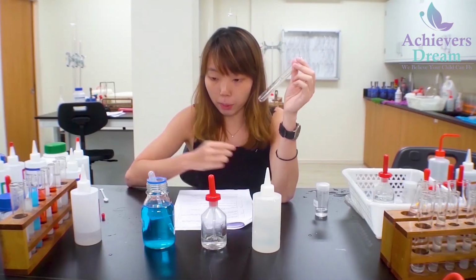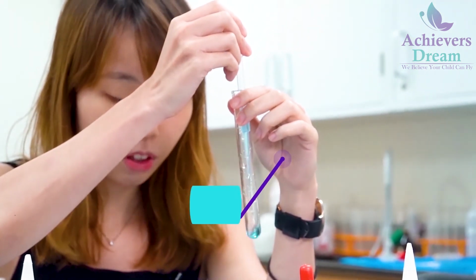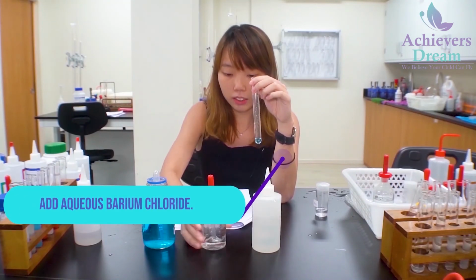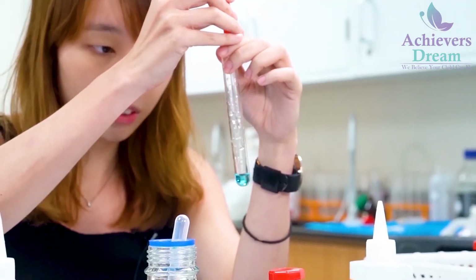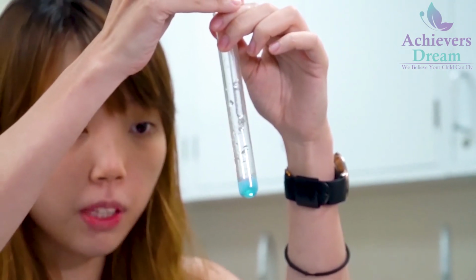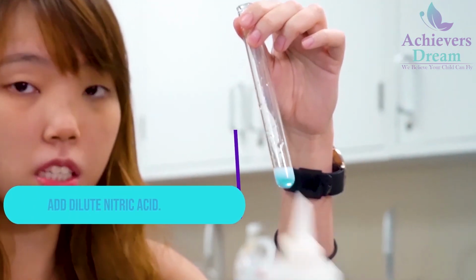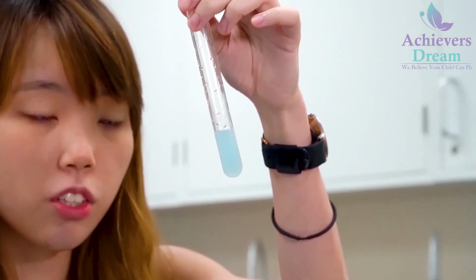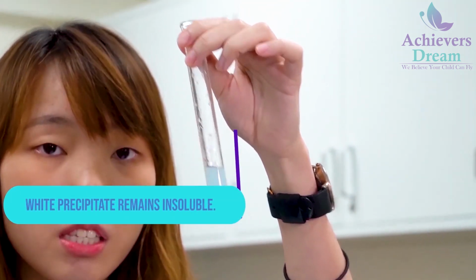Okay, so for part F, I'll be placing 2 cm cube of solution Q into a clean test tube. Okay, and I'll be adding aqueous barium chloride. So upon addition of barium chloride, you notice that there's white precipitate. Okay, and then I'll be adding in dilute nitric acid to this mixture. So even after addition of dilute nitric acid, you notice that the white precipitate still remains, or you can see that it is insoluble.